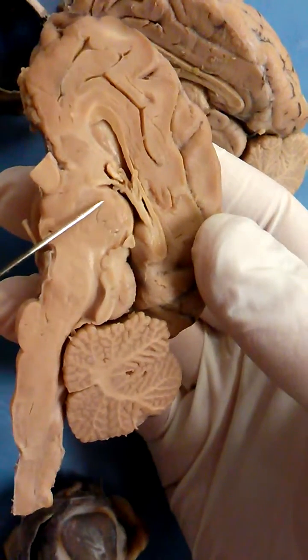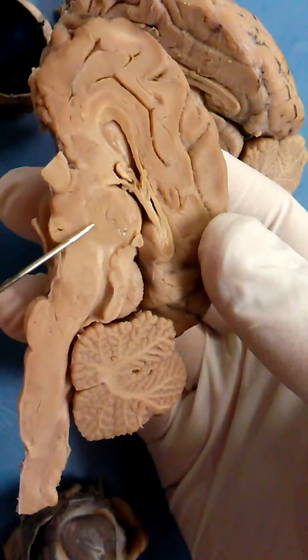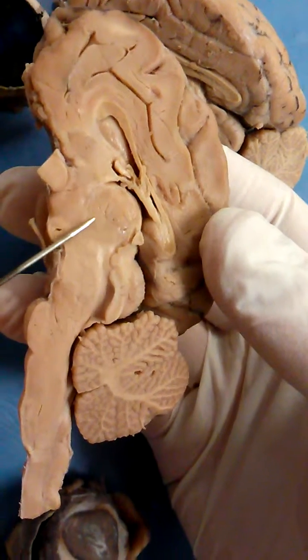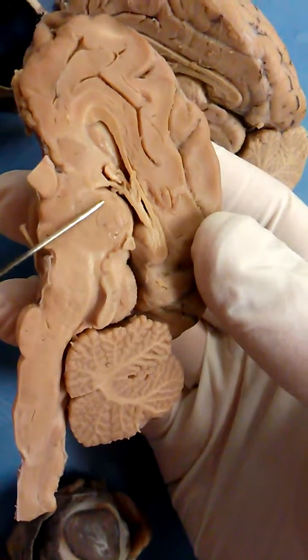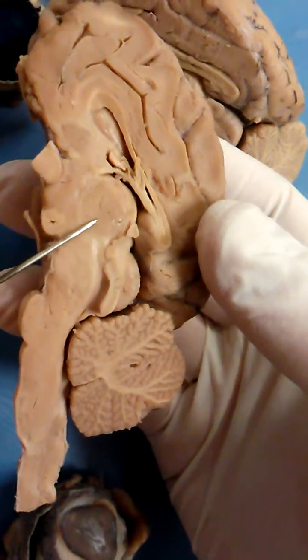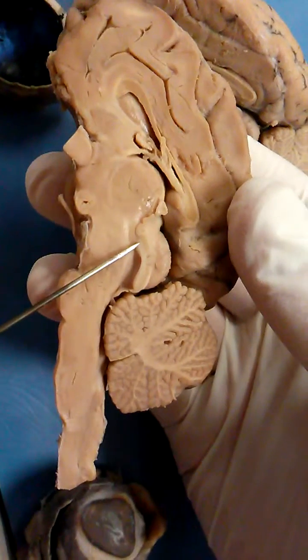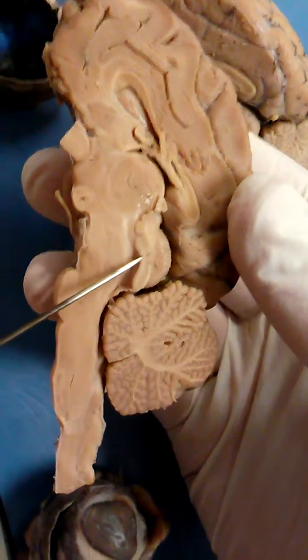Right here we have the intermediate mass of the thalamus — that little round area. Right here we have the corpora quadrigemina.